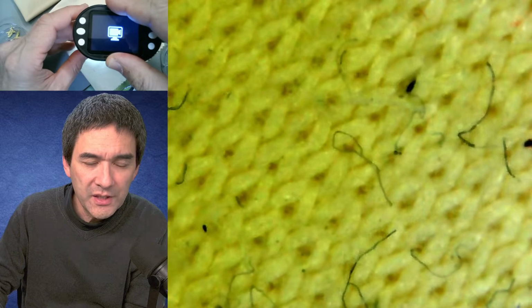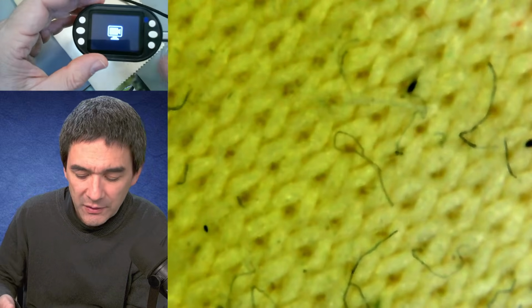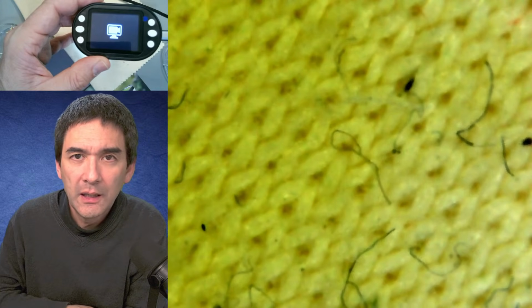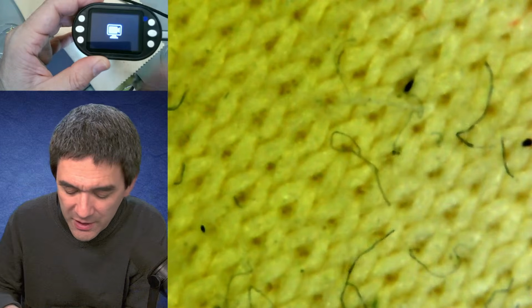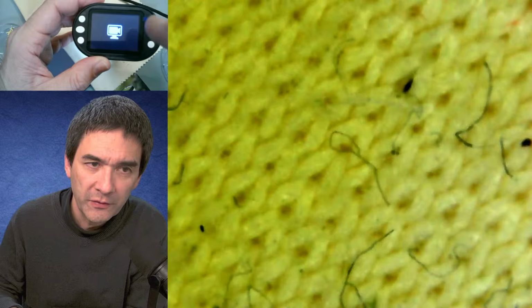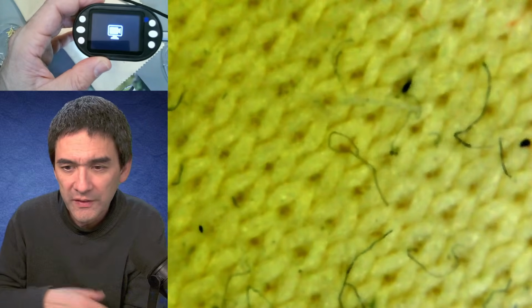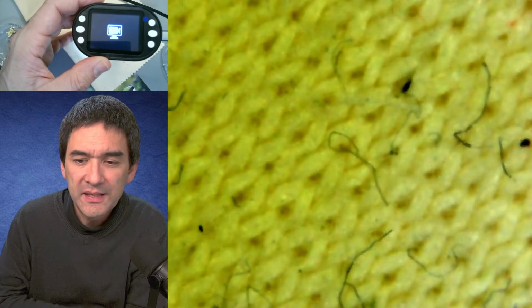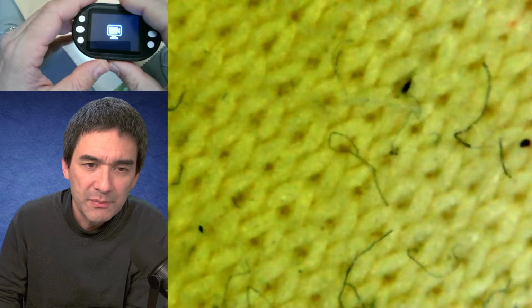Now, you probably already know that I've already showed you some very similar models that can be directly connected to a mobile phone, for example. Of course, this also works, but I thought that a self-contained system where you can directly record and also observe is more convenient. Later, I'm going to show you what the screen looks like. So how do I compare it with my second cheap USB microscope? I would say the image quality is pretty similar.